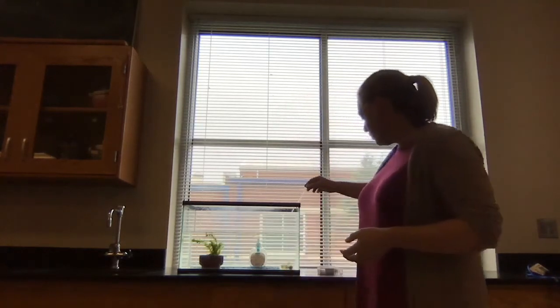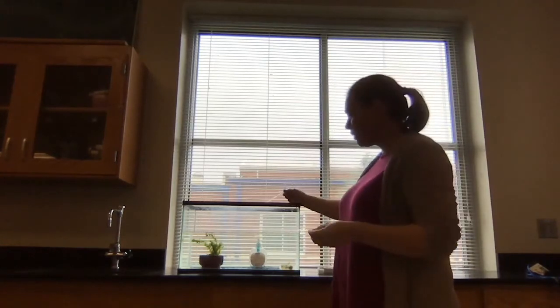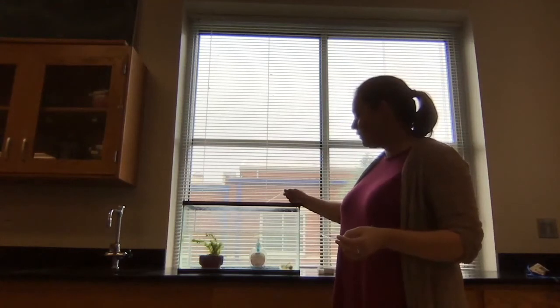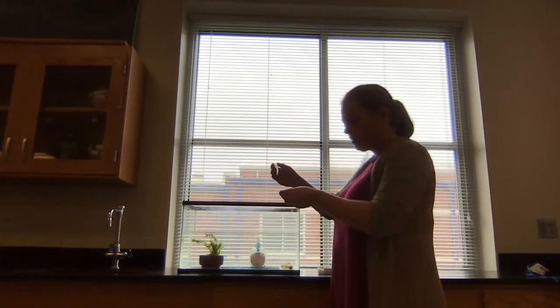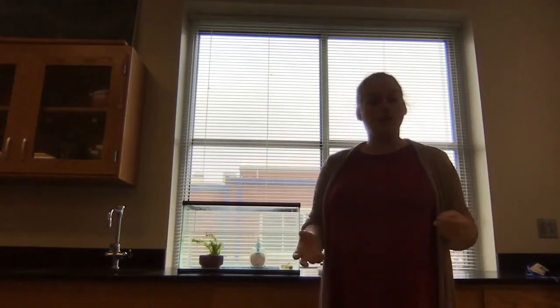And I'm going to use a slide to make a wet mount of what I'm looking at. And I might make 2 or 3 wet mount slides to see if I can find some different living organisms moving around under my microscope. So I'm just going to take my liquid this time, which has the specimen in it, and I'm going to take my cover slip and place it on at an angle. And I'm going to put this under my microscope. I'm going to draw off the top a little bit, and I'll take some videos and pictures of what I'm able to find, and we'll talk about those in your lab.